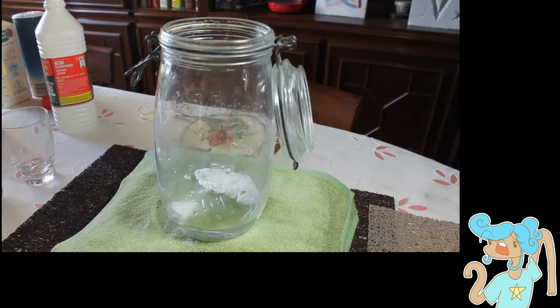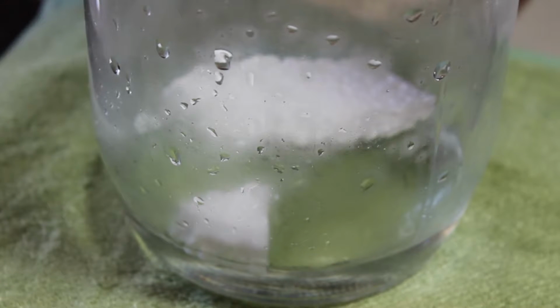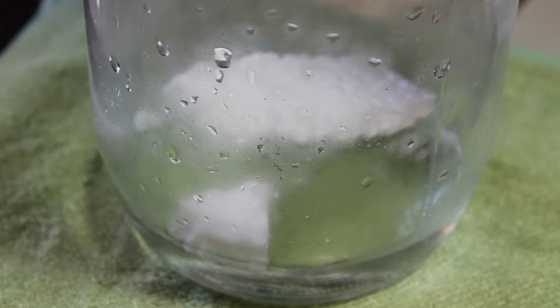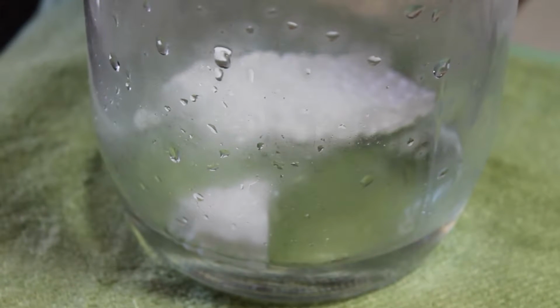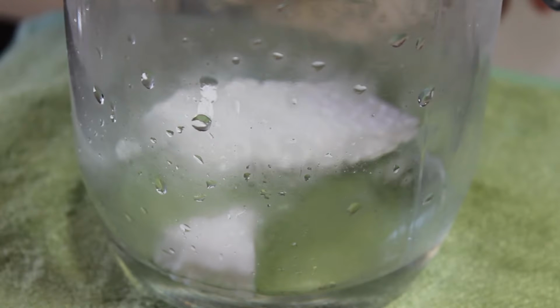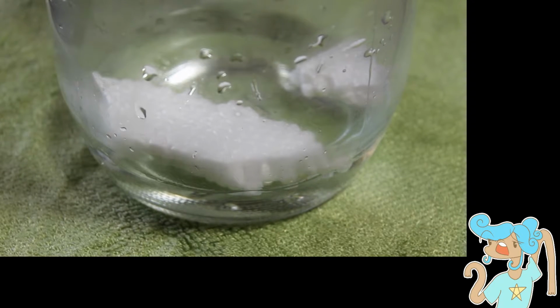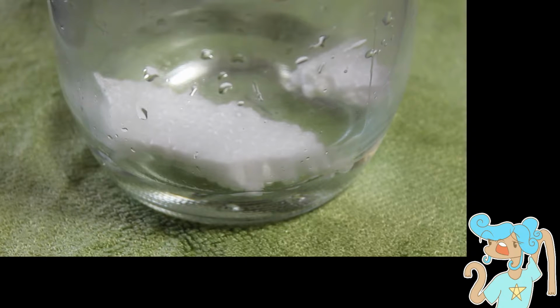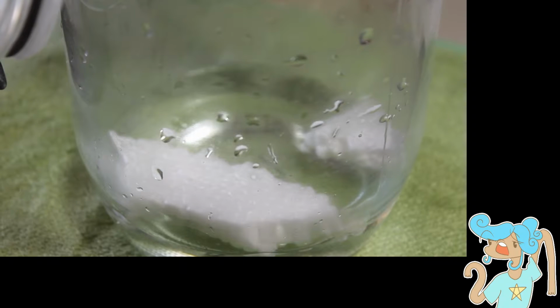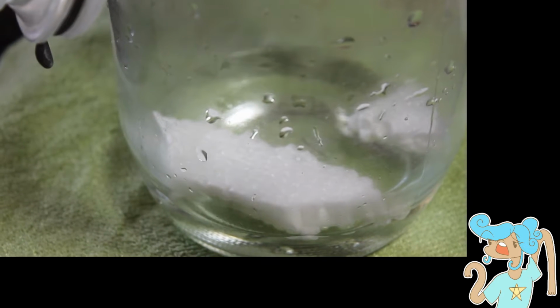And by the way, the sugar experiment didn't give us any chemical reaction. Alright, we're starting to have some steaming inside the container. The steaming might have been the condensation of water due to the heat of the lamp on top. So no reaction for that one.